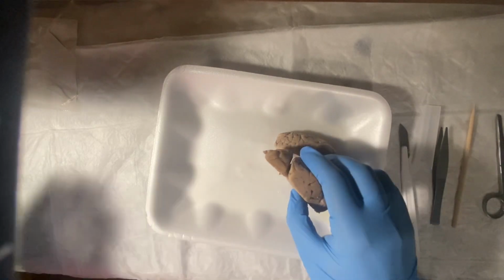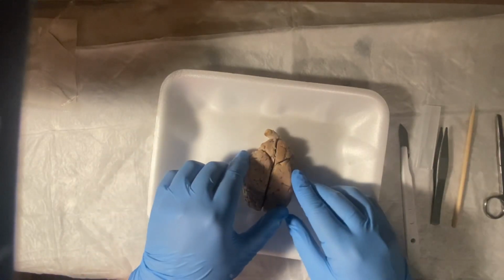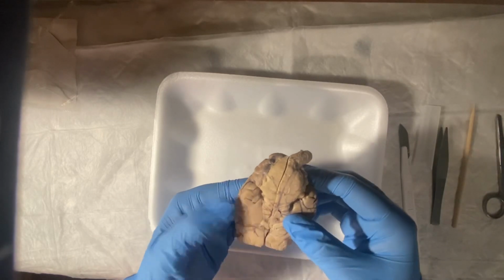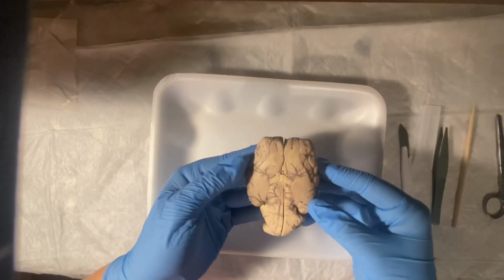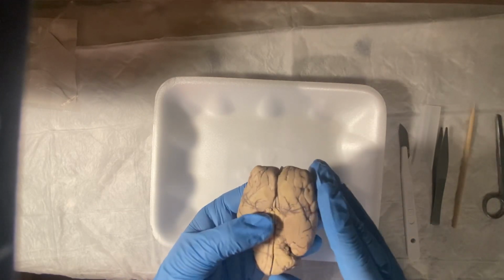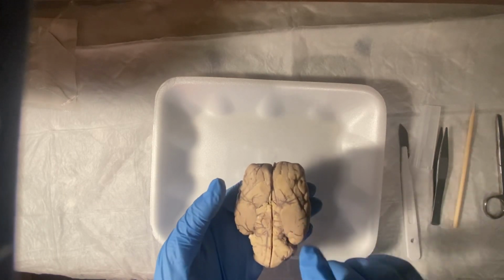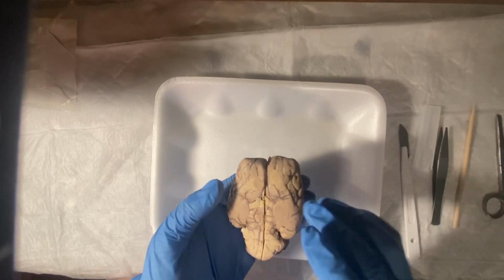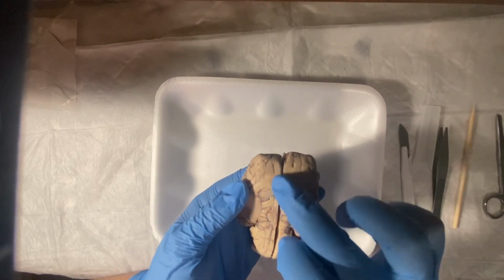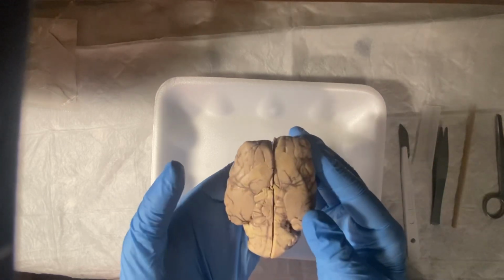We could go and look at the nerves. So if I put it back together, oh my goodness. If we put it back together, we go behind. Let's do it this way. Okay, they're pretty hard to see, but if we look at the nerves, like cranial nerve 1, cranial nerve 2, we can see cranial nerve number 1 is the olfactory nerve, and that's the sense of smell, and that would be around up here. Around here. Around here. Mine is very squished.